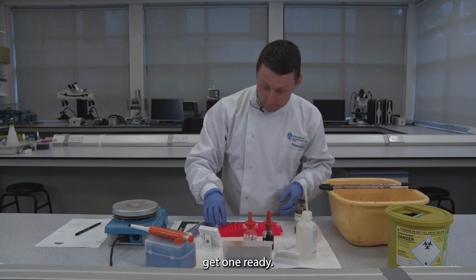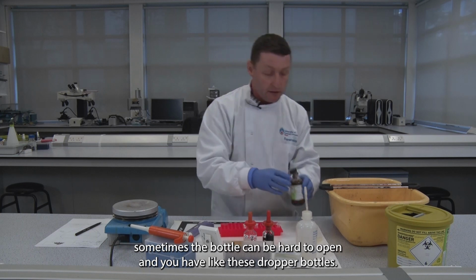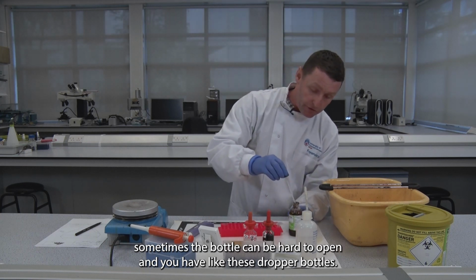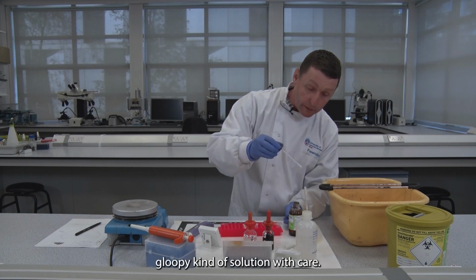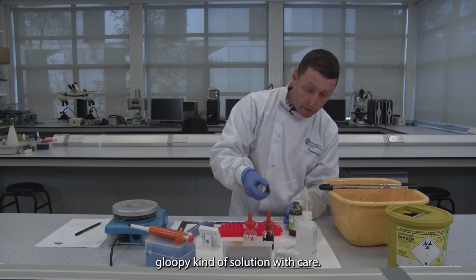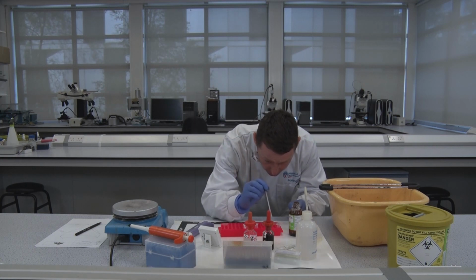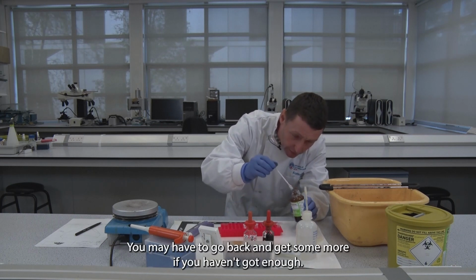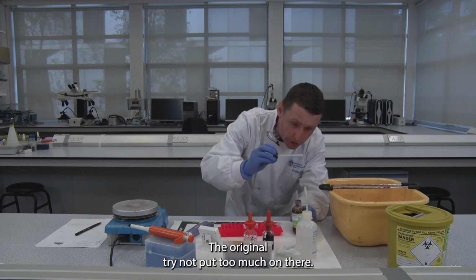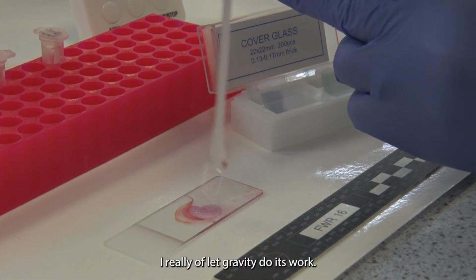get one ready. So sometimes the bottle can be hard to open, and you have these dropper bottles, and as you pull it out you'll see this transparent, gloopy kind of solution. With care, you want to hover over your sample and let gravity do the work. You may have to go back and get some more if you haven't got enough of the original. Try not to put too much on there. It's just by eye really, let gravity do its work.